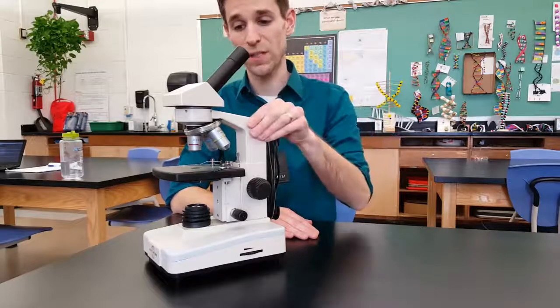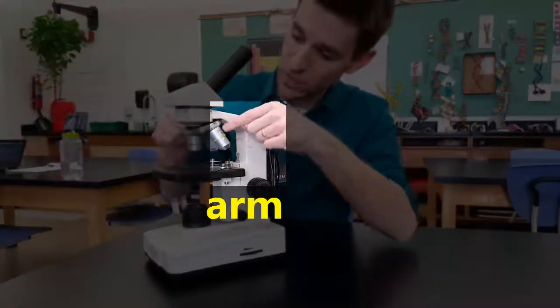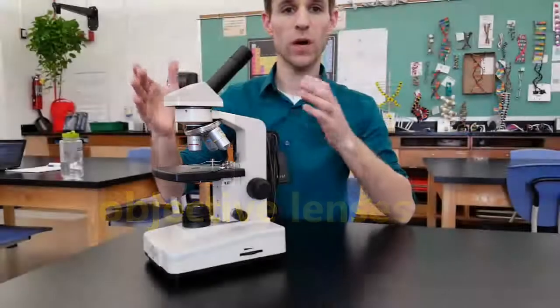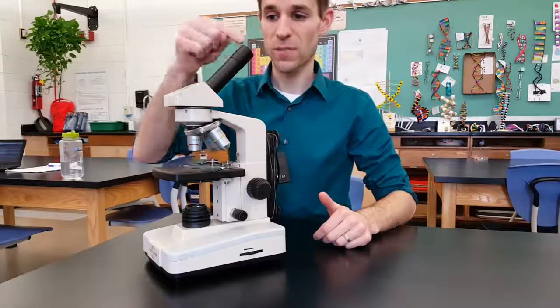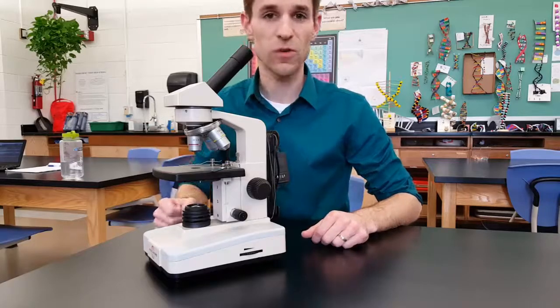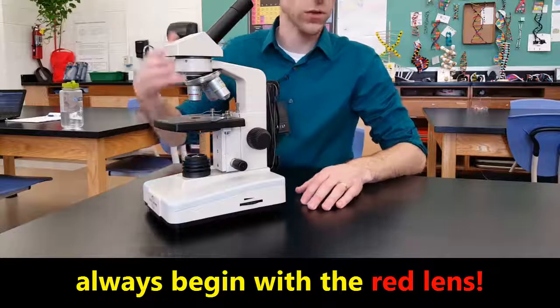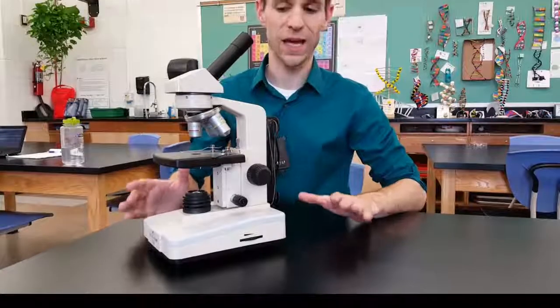This right here is the arm. Its main function is simply to hold up the head, eyepiece, and the objective lenses right here. The objective lenses are on a turret — a turret is something that turns. When I find the scope and I'm ready to use it, you'll notice the scope always has the red lens locked into place, and you view through the red objective lens. One of the first big things to know is that when you put the microscope away, you've got to make sure the red lens is in place, because we always start with the red lens.